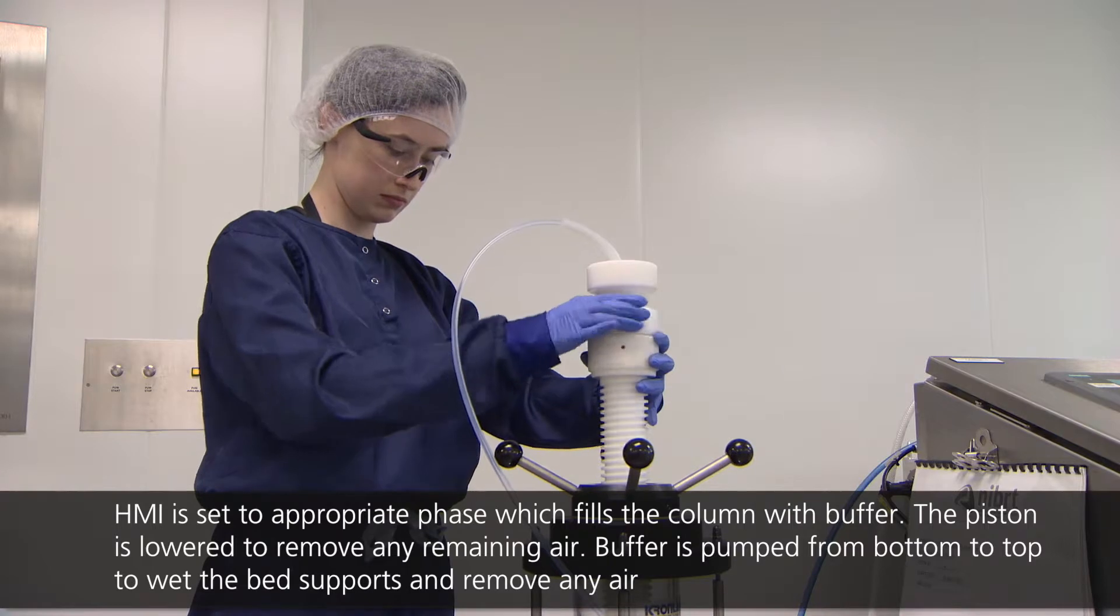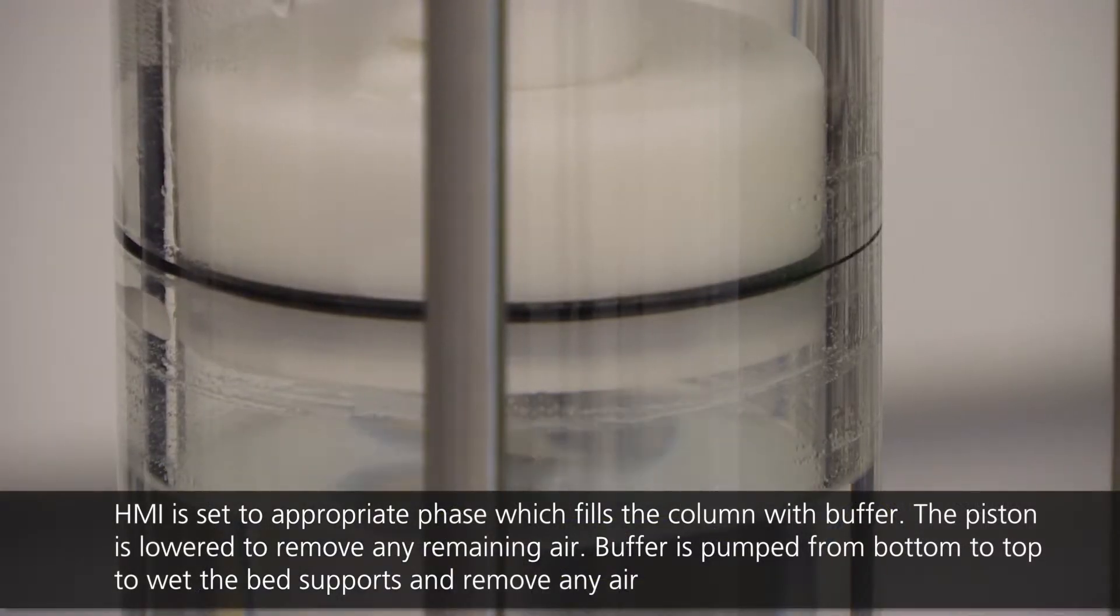The operator tightens the piston seal to ensure a seal is formed between the piston seal and the glass column wall.